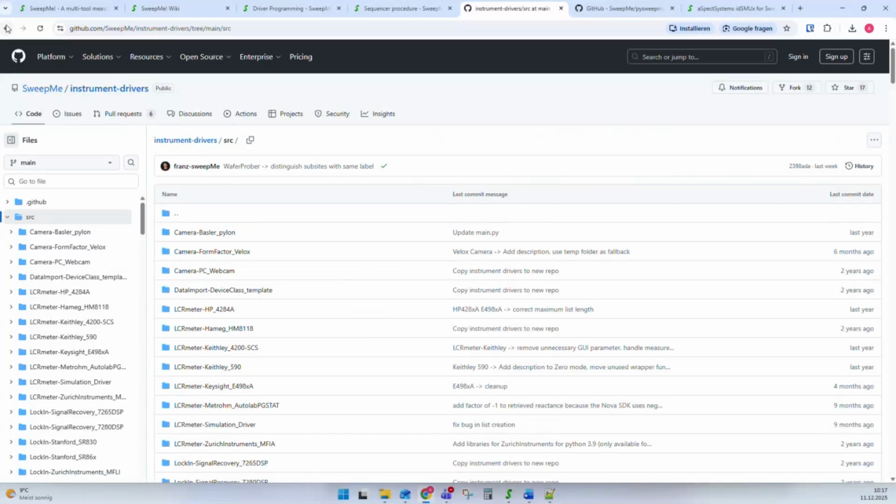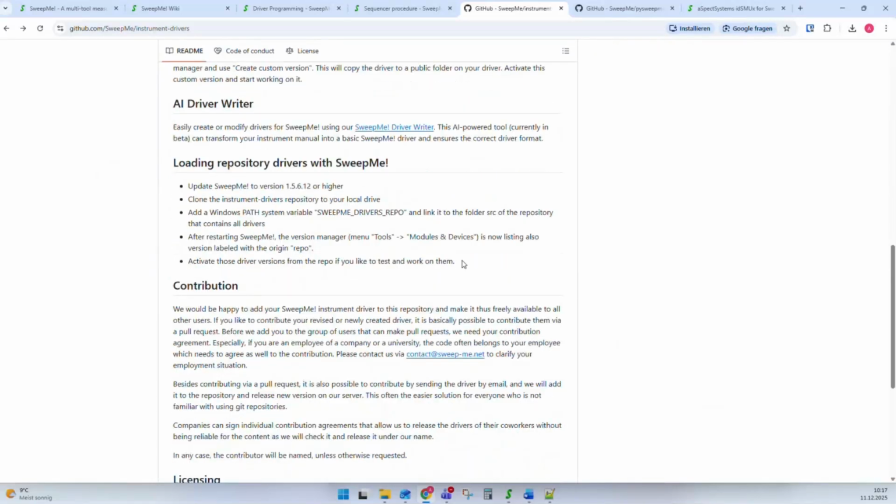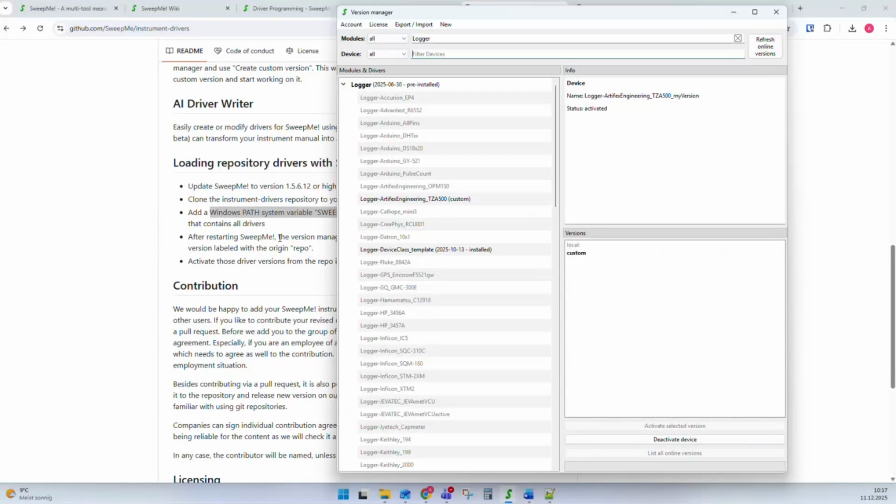If I go one step back to where I can see the documentation of this repository, there's also a guidance how you can add a Windows path variable like SweepMe drivers repo. After adding this, the drivers will be found in the SweepMe version manager, and you can find further versions and instrument drivers here in the version manager. This means once you are developing a lot of drivers, it makes sense to work with this repository or with your own repository, add the drivers there, and then you can simply add drivers also in your repo directory.